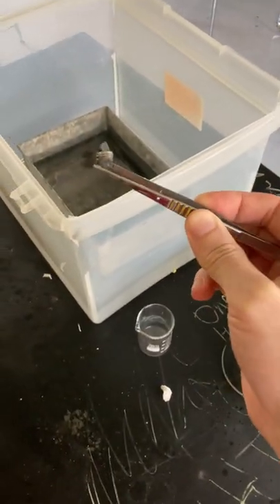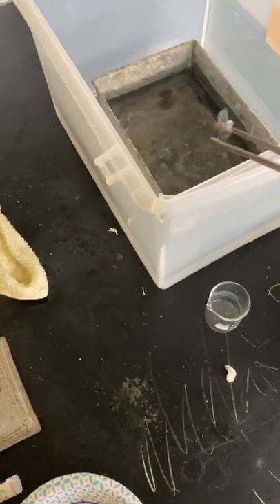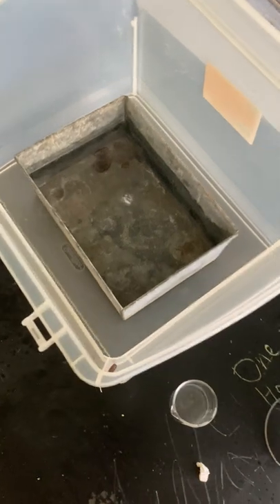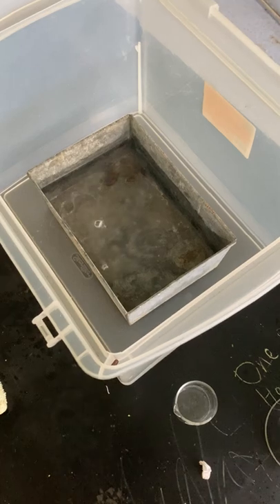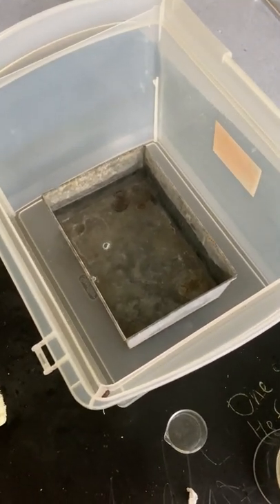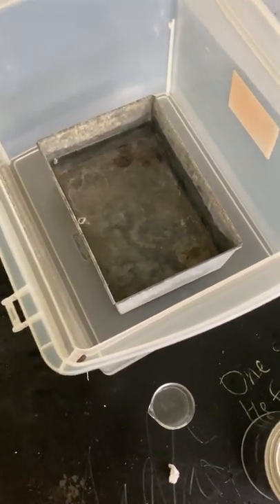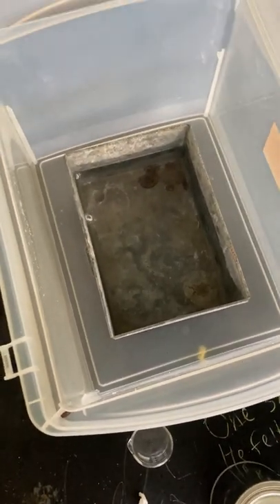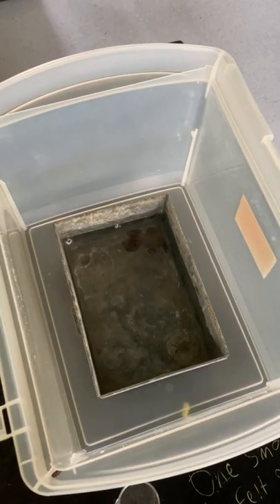So I have lithium here. It's just kind of fizzing and zooming around — you can hear it. It's not super reactive, but it's kind of reactive. So this is kind of a boring video.